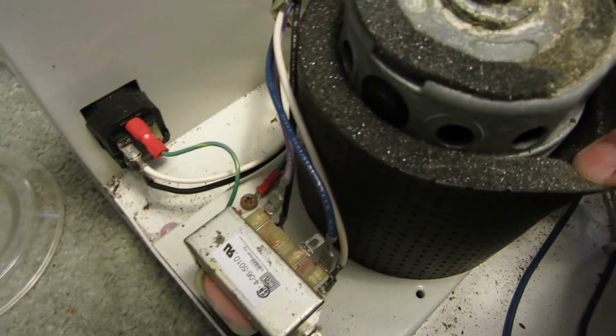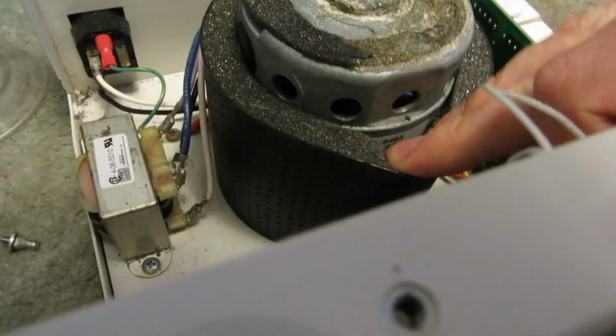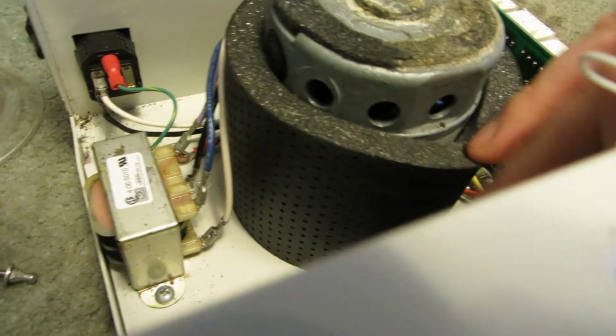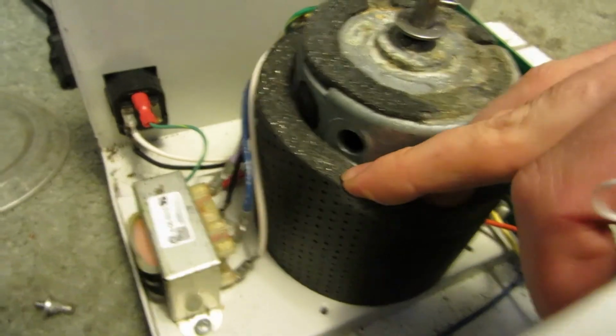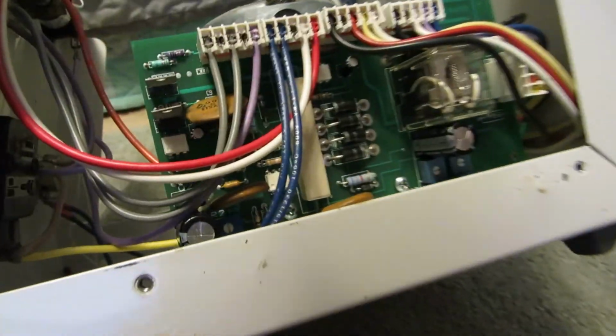Sound dampener. Oh, there's some information under here. What's that say? 115 volts. 6402-0799. No idea what that means. Might be your production number or something. And so we see a brushed motor. Now, other than that, there's not much else to show you.